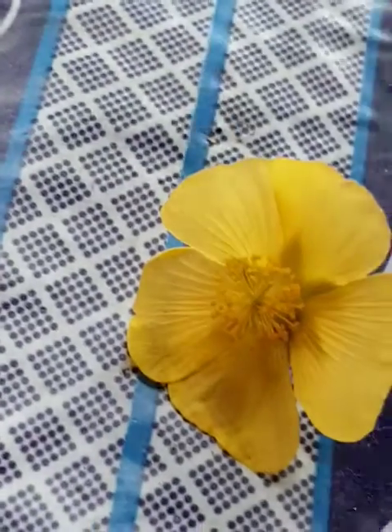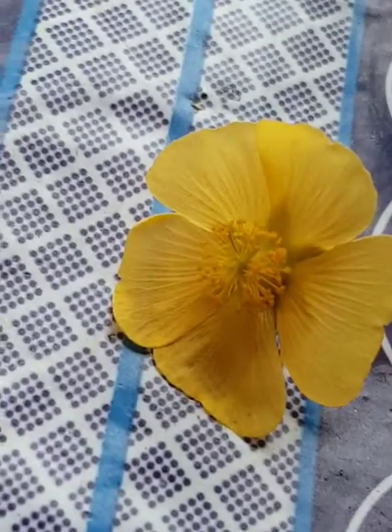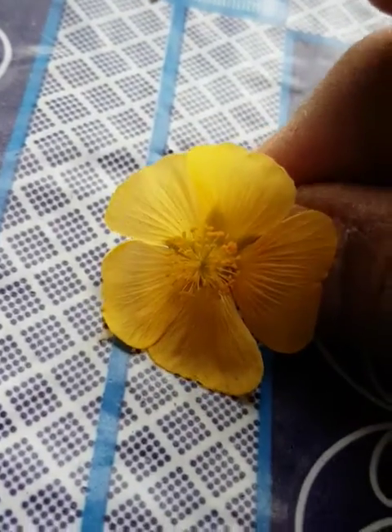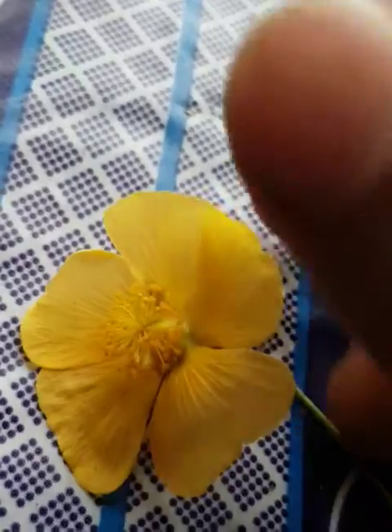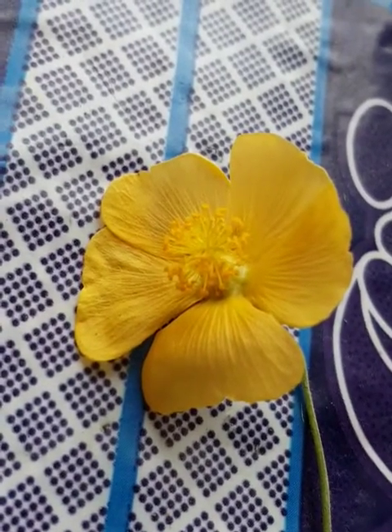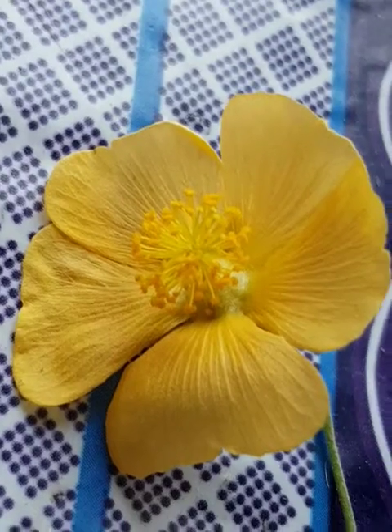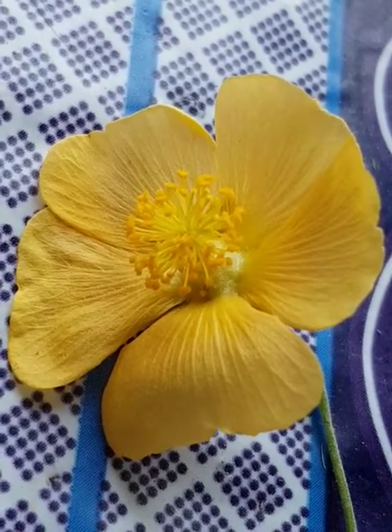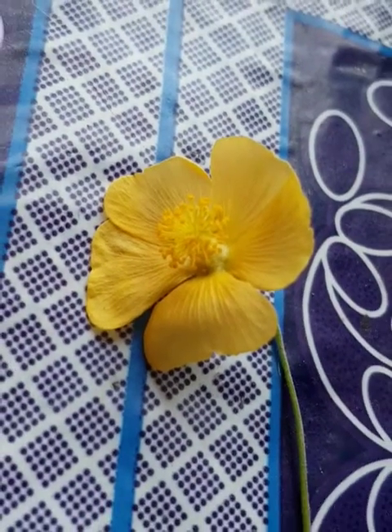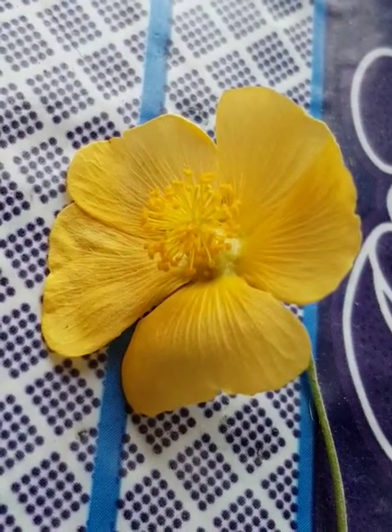I'll be showing you the pollen grain of this particular flower — it's a yellow wildflower. I'll show you how it appears in light. The anthers are like this. I'll try and identify this wild yellow flower and show you the pollen grains. I've sprinkled the pollen grains on the slide.